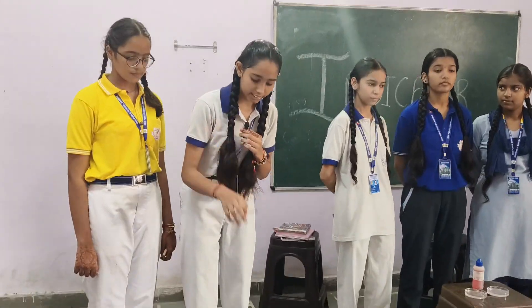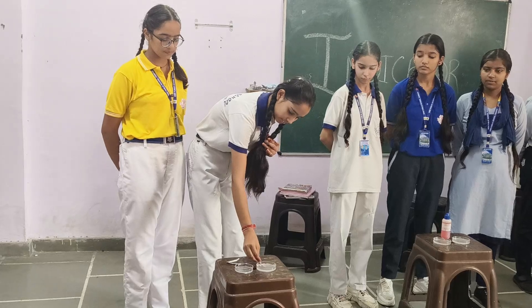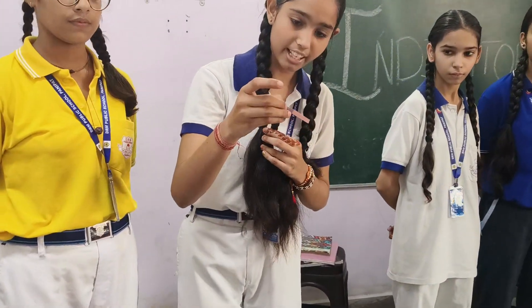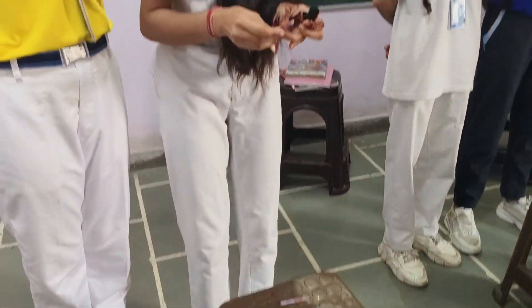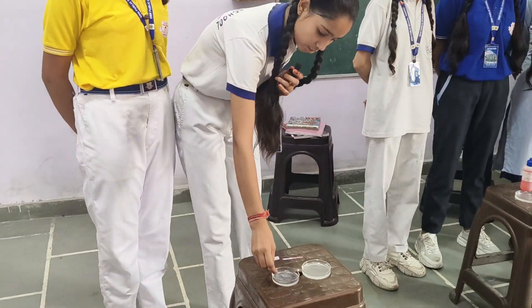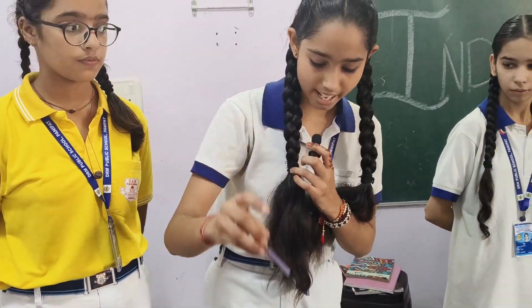This is a litmus paper. There are two solutions. We dip one litmus paper in one solution. There is a change in color, blue to red — there is acid. We dip the litmus paper in the second solution. The color stays the same — there is a base.